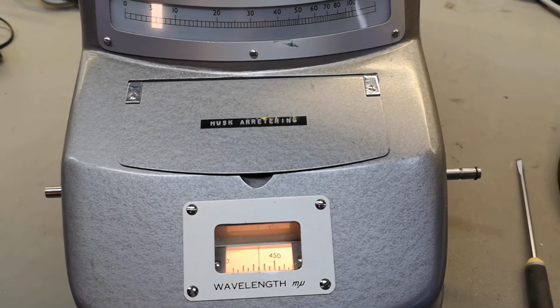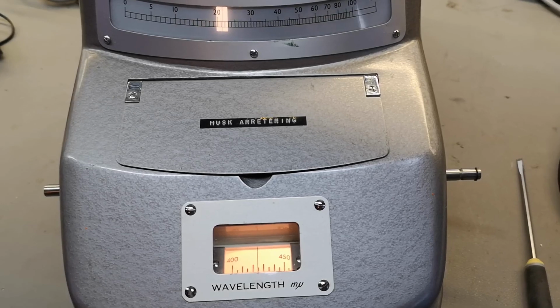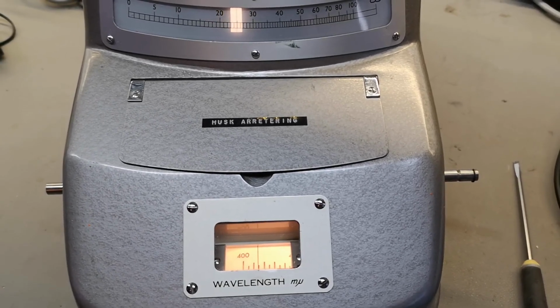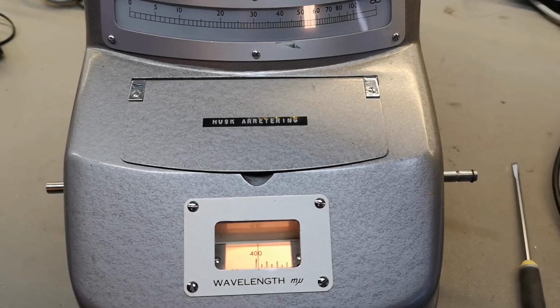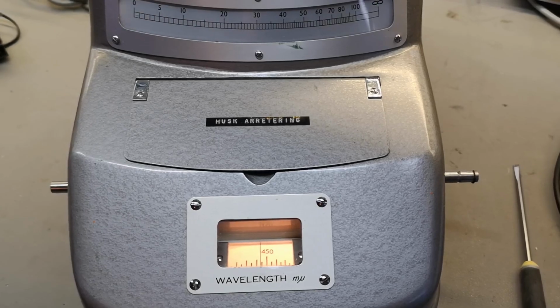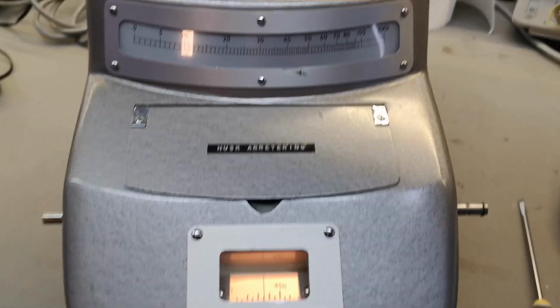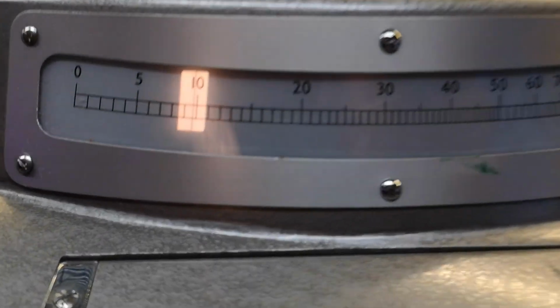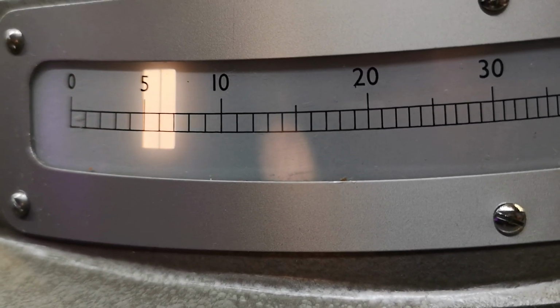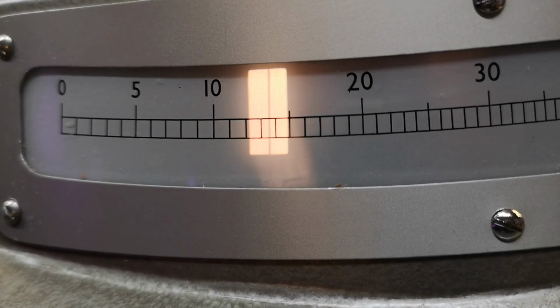And then all the way down. Yeah, look again. To 425. So that is my response. I really love this, the way that it is displaying this. Look at that. Isn't that just cool?